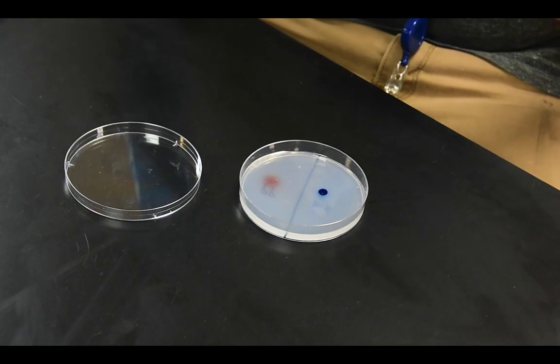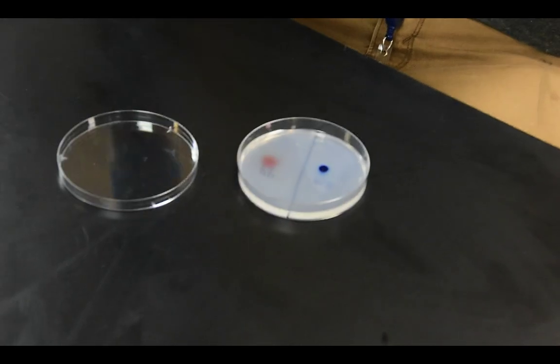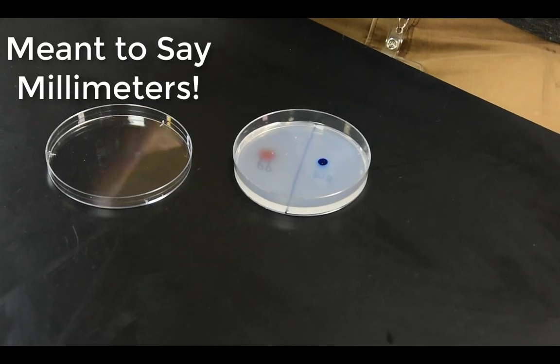Now notice that the potassium permanganate dot looks much more transparent, right? And that's because the particles aren't all concentrated in one area. They've diffused out. So they diffused vertically into the agar jelly. They've diffused horizontally away from the initial point.